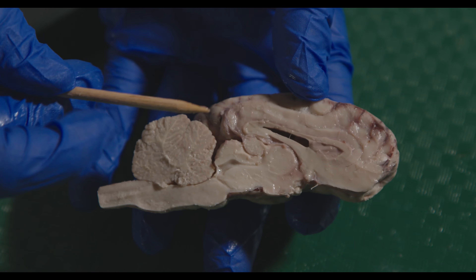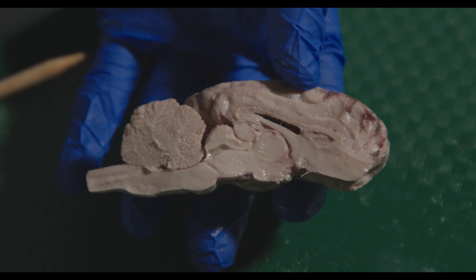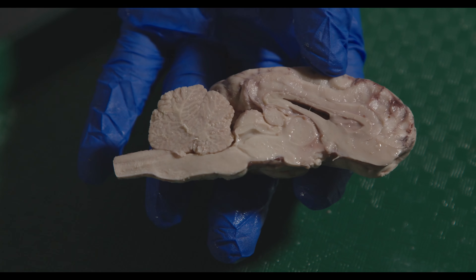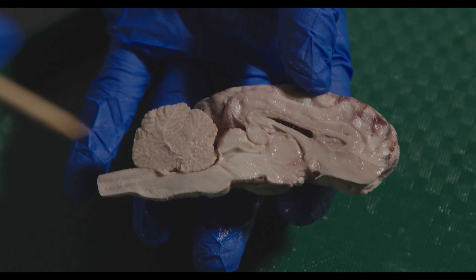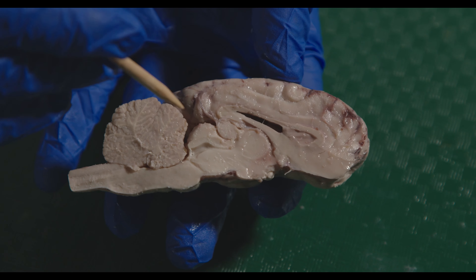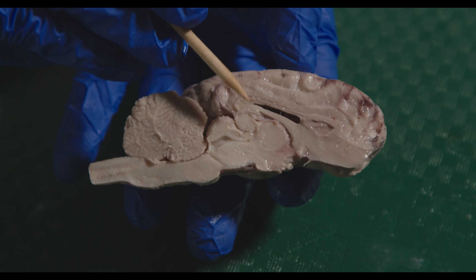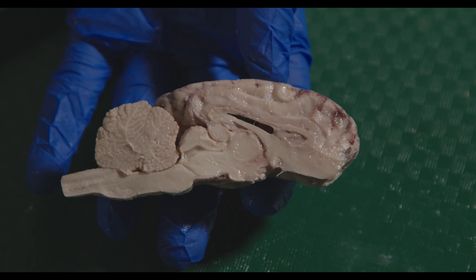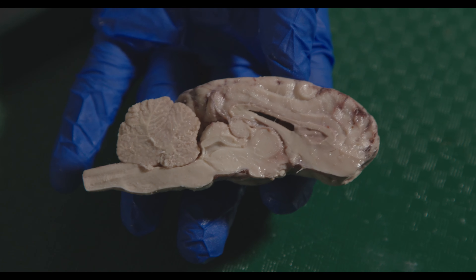There's also a diagram on your lab slides showing the same ventricular system in the human brain, which you should be familiar with for the lab quiz and lab practicum — both the sheep brain structures and the human brain structures.